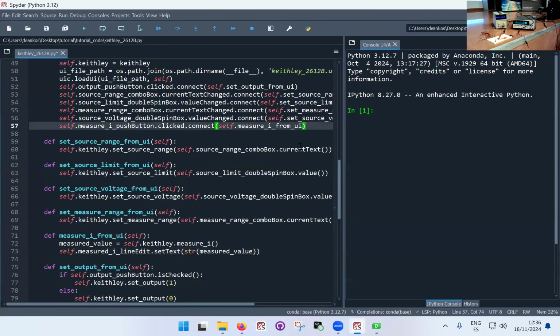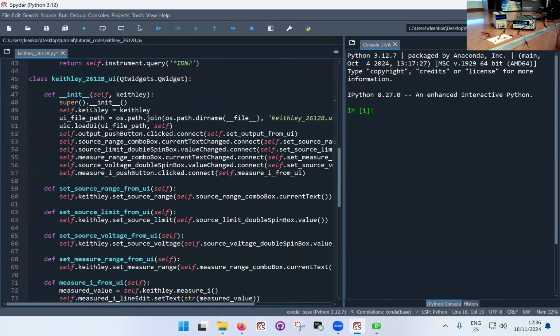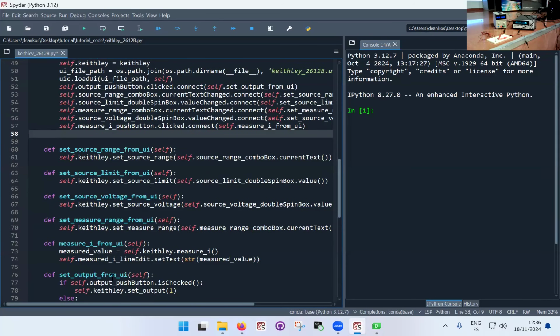Also, something that I might do right now, since there's nothing special about these functions. Even though I connected them to buttons, I can still use them separately. In fact, it's a good idea when you create an interface to initialize the instruments to have the values that come up in the interface. Because if you remember, when I generate the Keithley object, it resets to some standard settings, which are factory settings. So it's a good idea to execute all these functions one by one, so that when I run it, the Keithley will already have the settings which are in the user interface.